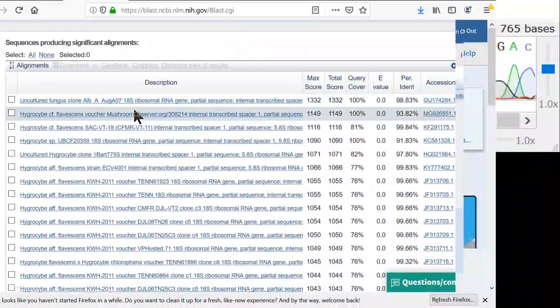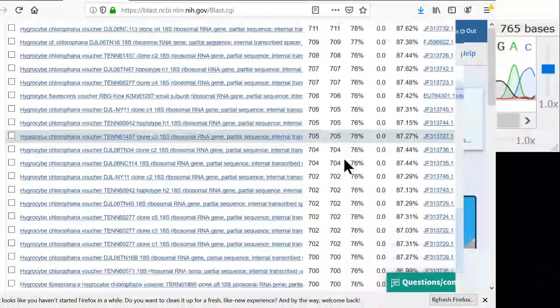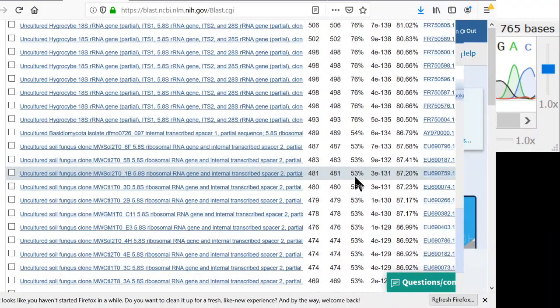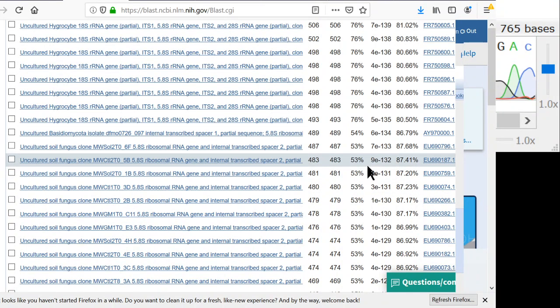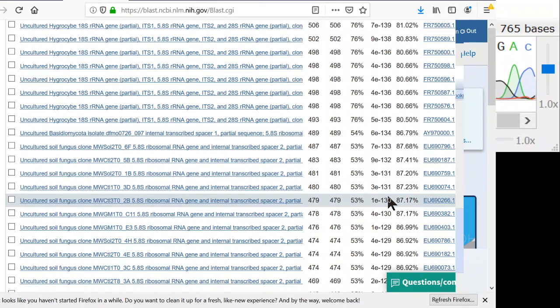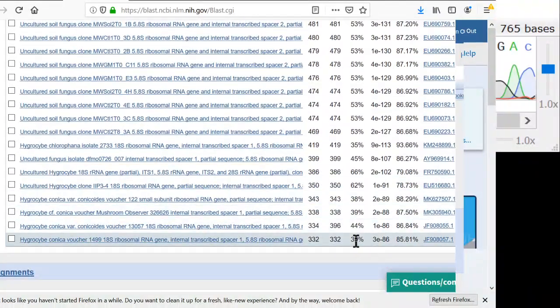So the query coverage, if it's pretty high, like 80% or 100%, then that's good and it means you're going to get a good match. But if the query coverage is really low, like 40% or 20%, here's some that are 67%, or like here, 53%, that means only 53% of your sequence is overlapping the other sequence that you're comparing against. And when you're only comparing half your sequence, you can start to get errors, like maybe some other mushroom has a conserved region, and so you're comparing these conserved regions, but knowing that you're only looking at 53%, the query coverage is really important. And here there's some query coverage of 39%, so when you have it that low, you know that this is not really a good answer.